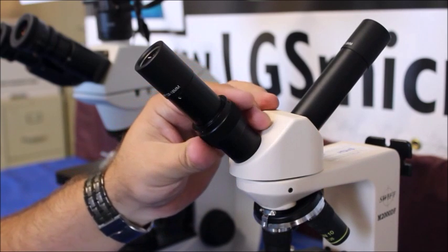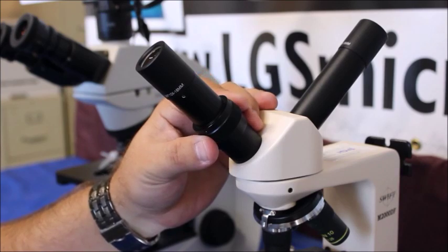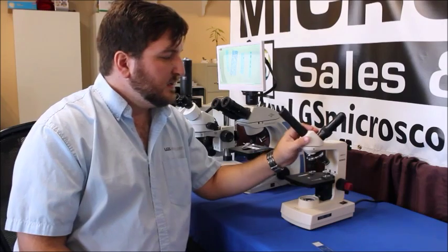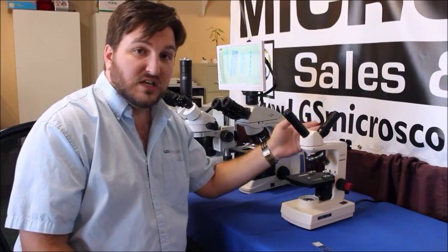Now some of you might have one of these microscopes that has a second head. Now what's that all about? The purpose of this is so that you can have a second person looking at the same sample at the same time.